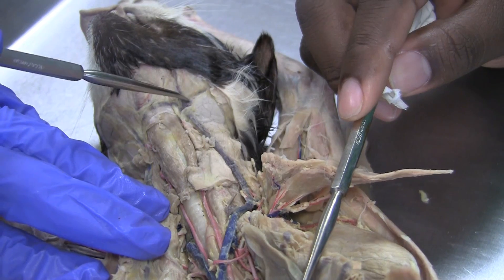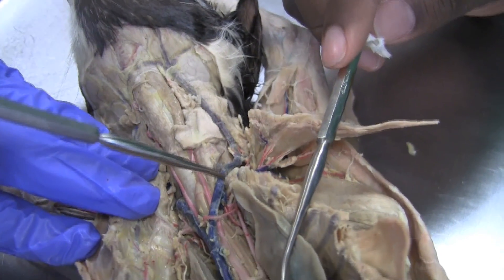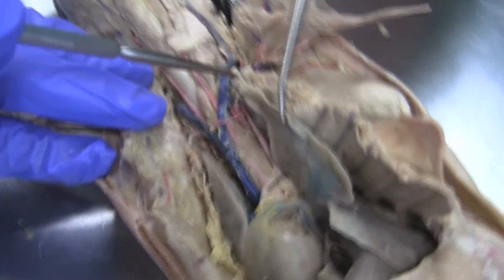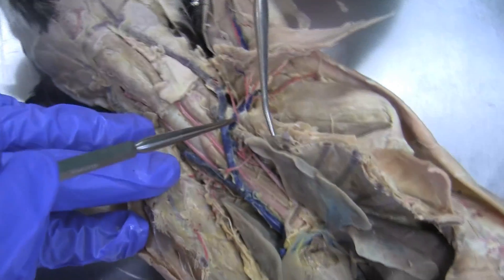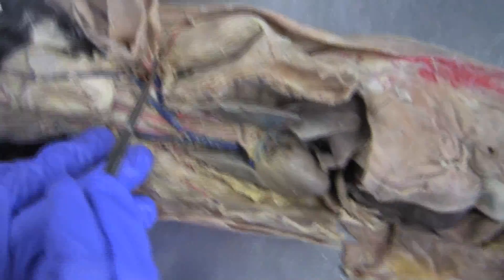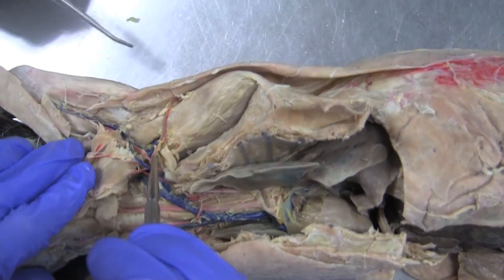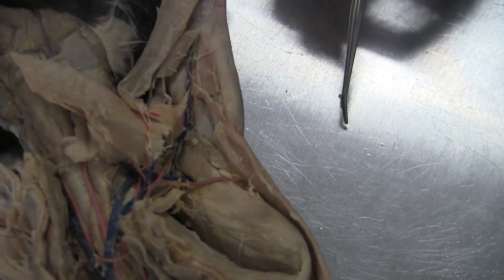The anterior facial vein. Posterior facial vein. Then this goes to the left subclavian. Left subclavian. Then goes to axillary. Axillary then goes to brachial. And it's the exact same on the other side.